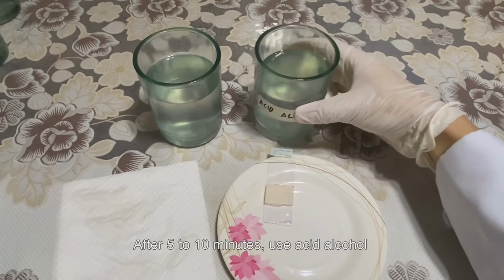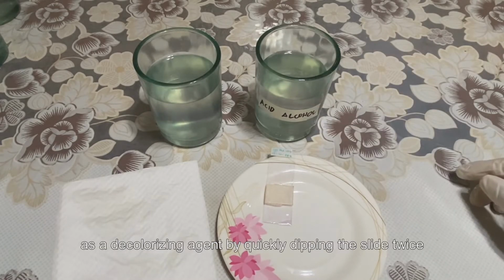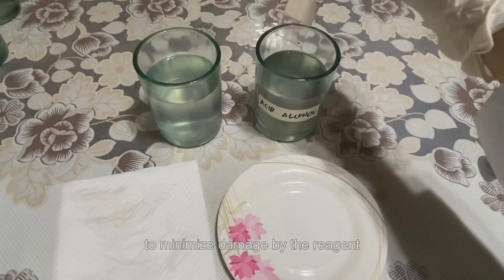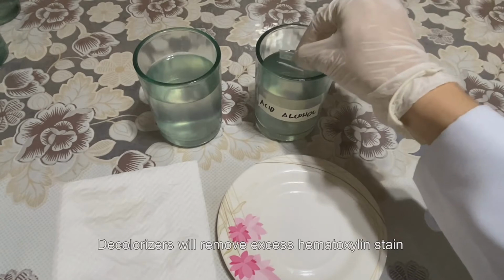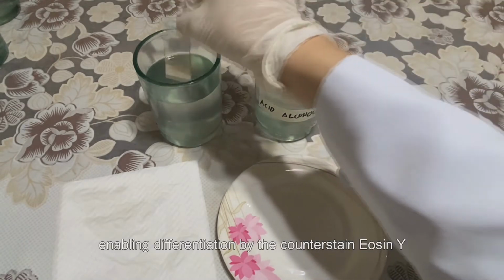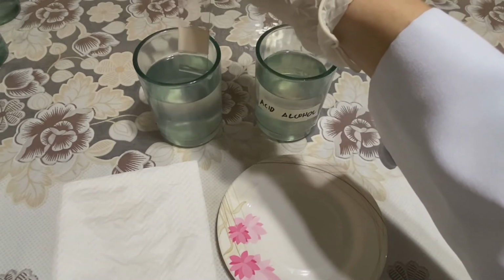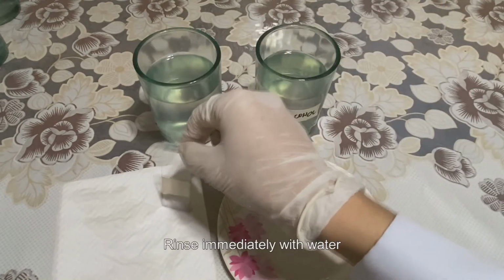After 5 to 10 minutes, use acid alcohol as a decolorizing agent by quickly dipping the slide twice to minimize damage by the reagent. Decolorizers will remove excess hematoxylin stain, enabling differentiation by the counterstain eosin Y. Rinse immediately with water.